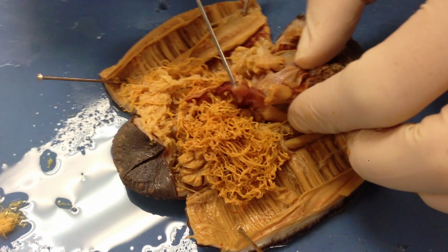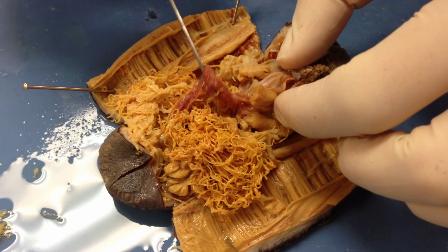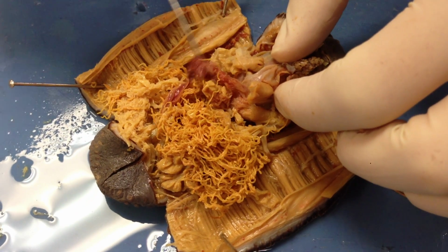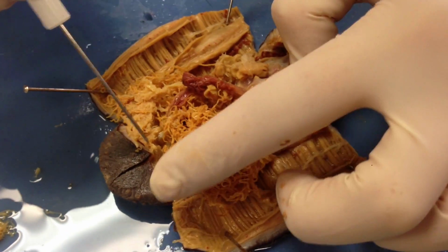This red structure right here, which could be a white, creamy colored structure in your organism if it isn't dyed, is the Polian vesicle. It's used for storing things like fluids, aids in the water vascular system.